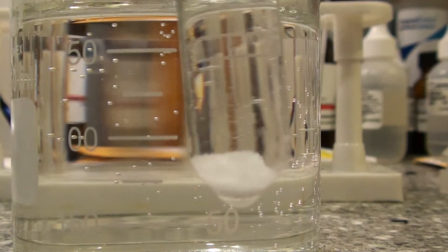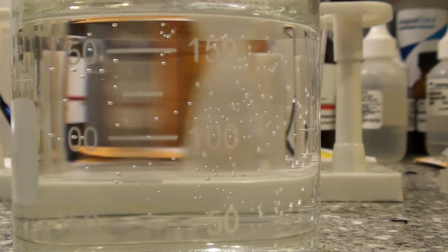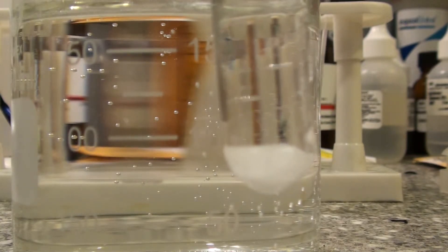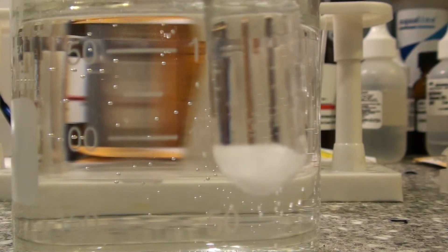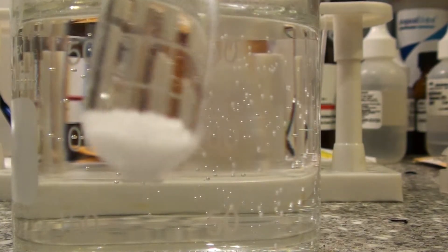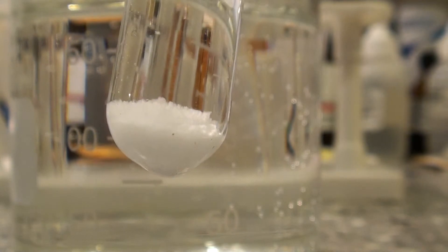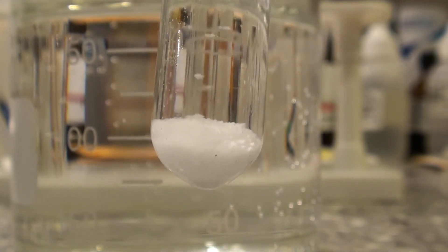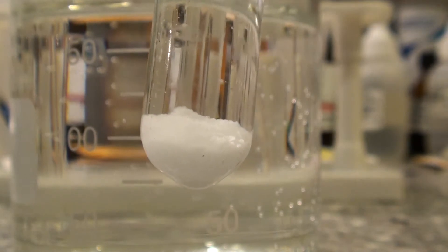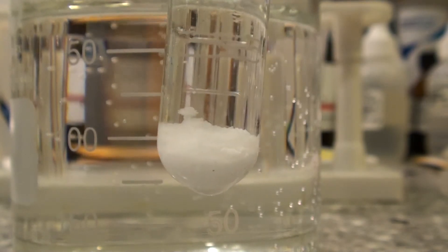Here's the chemical. There's some water, I'm going to hold on. Okay. It's slowly rising. As you can see. See the falling particles? Those are pieces of Ammonium Chloride falling. It starts to crystallize on the walls of the test tube. It gets bigger and falls. As you can see here.